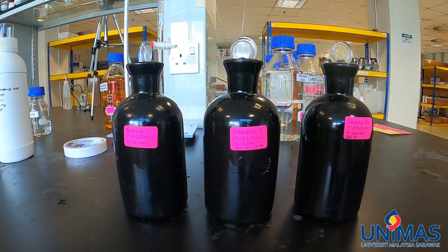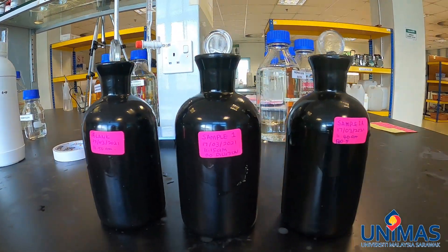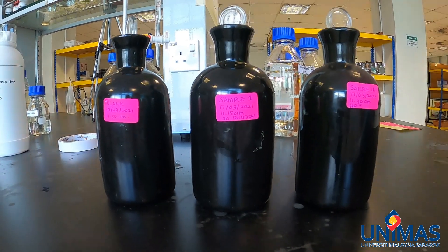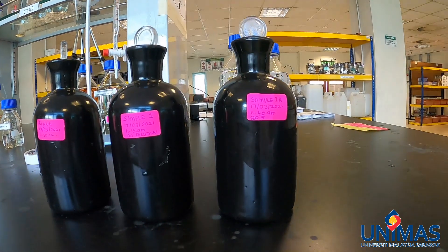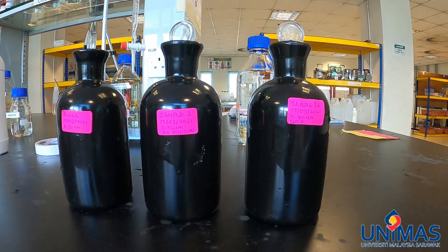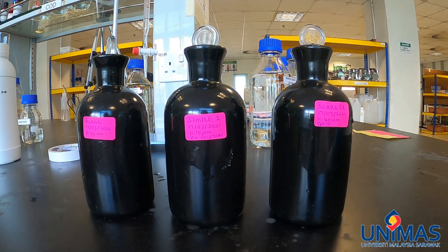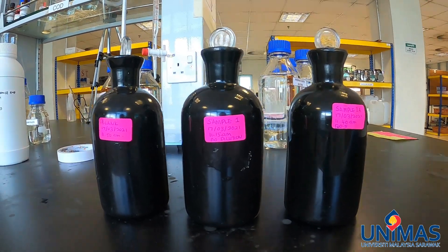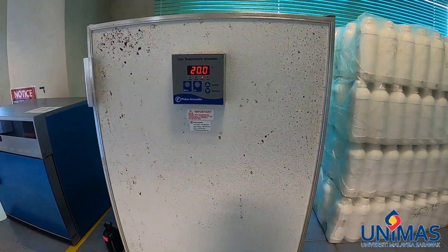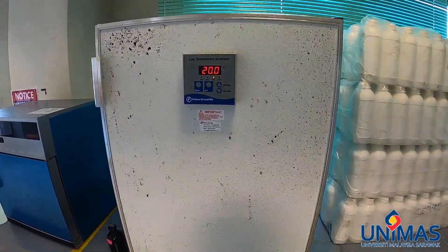We have now prepared the BOD bottles: a blank sample, a sample without dilution, and a sample with one-to-one dilution. Normally, for each dilution level, we have more than one replicate to make sure that if there are any outliers, we can take the closer of the readings — typically three replicates per dilution level. Now we are going to put the BOD bottles into the 20 degrees Celsius incubator.